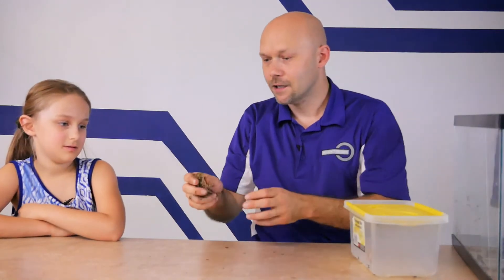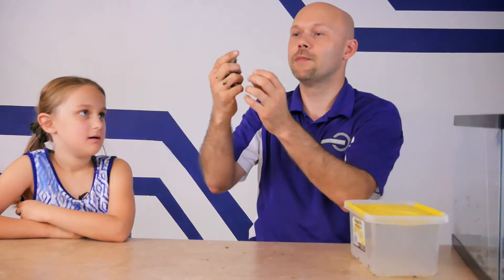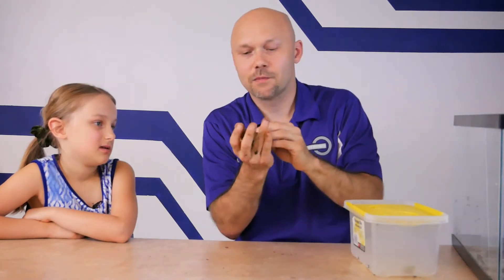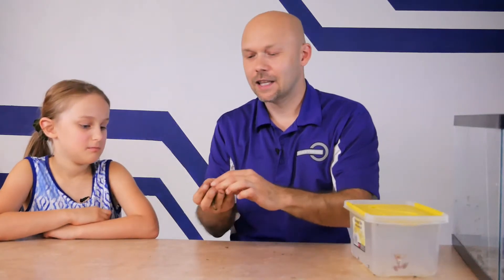This is a toad — a little bit easier to handle. If you hear that chirping, that's a male toad — he's nervous but I am being very gentle. They do jump, just not as far as the bullfrog. Tren, you want to touch it and feel that skin? It's pretty dry, isn't it? This is a toad — he's a lot drier. Toads like to live more in the ground. They do urinate as a defense mechanism — they can excrete things out of their bladder and also out of their skin to ward off predators.